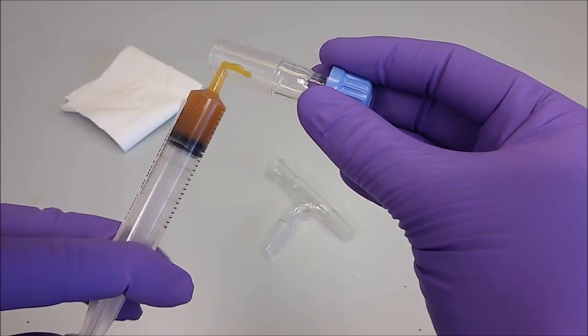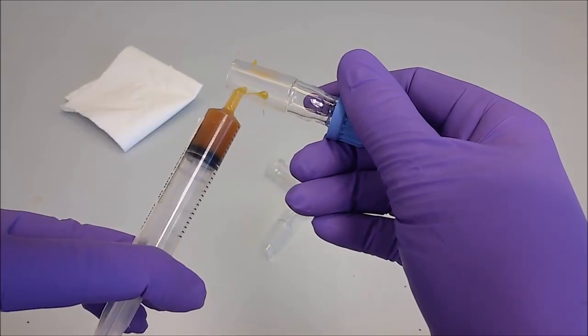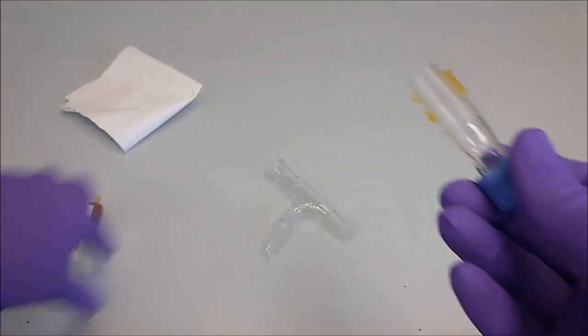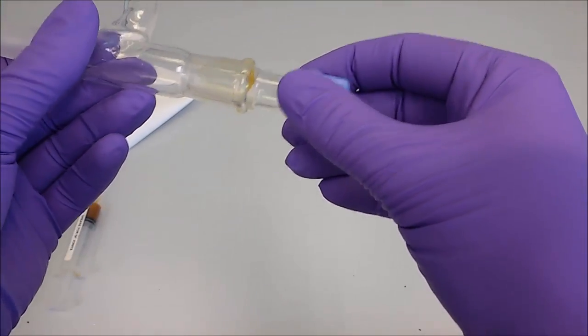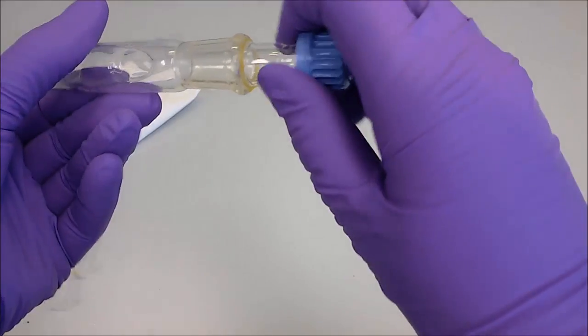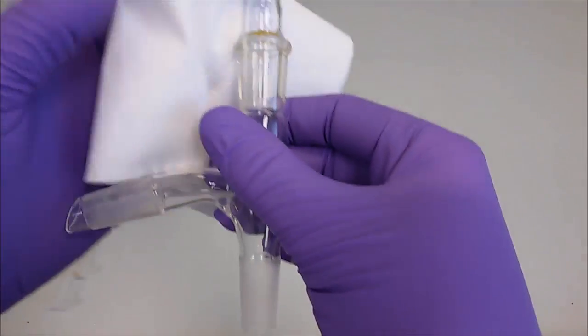You will find the grease in plastic syringes. Make two lines on the joint, put two pieces together, and turn them to spread the grease. Wipe any excess using clean paper.